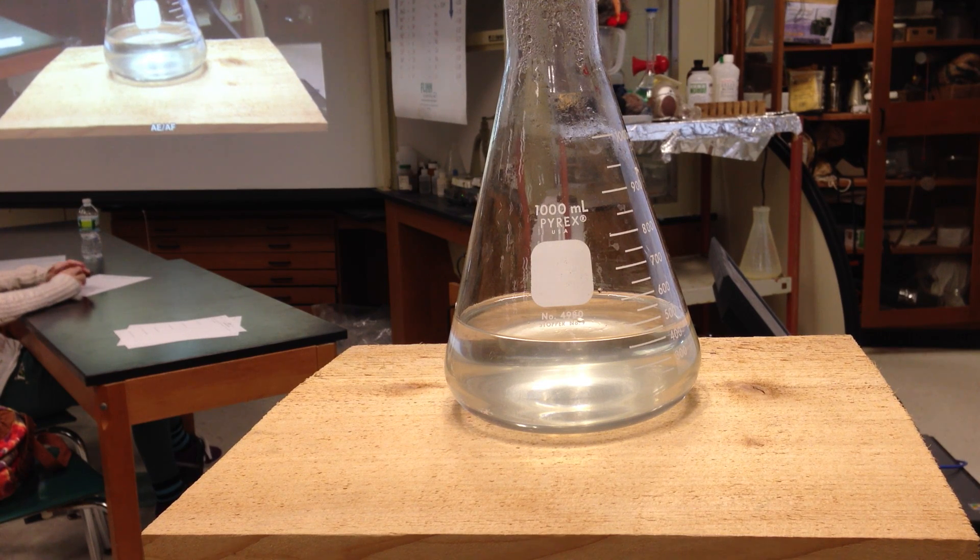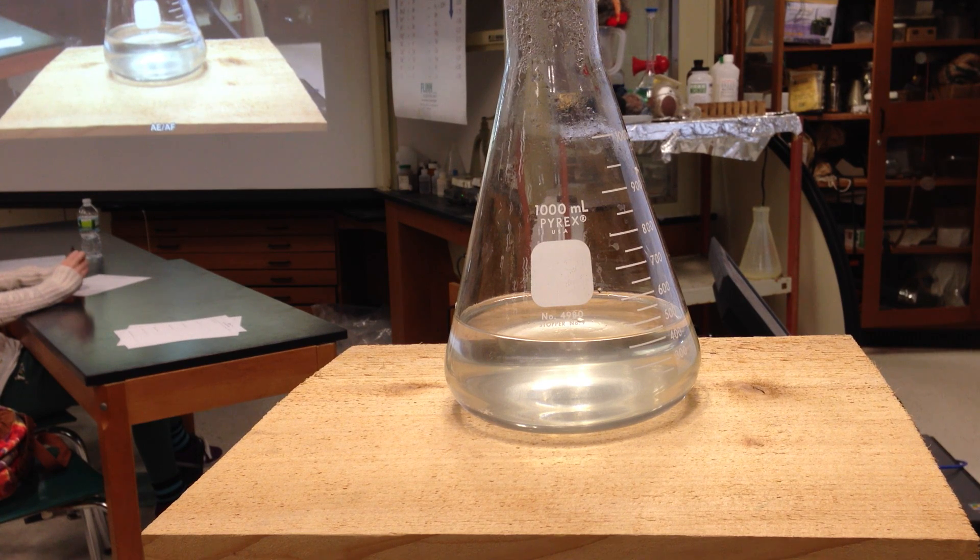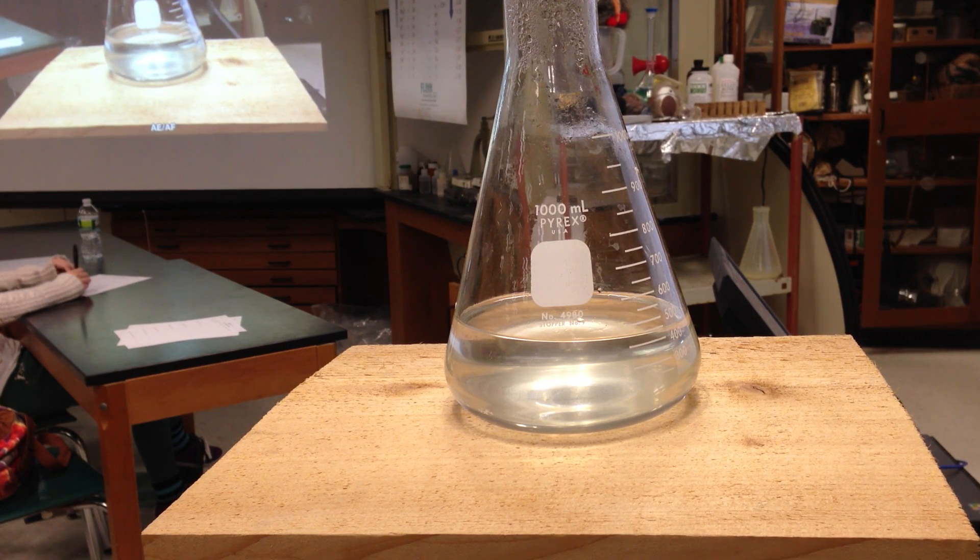Now, supersaturated solutions are unstable, which means they're eventually going to come out of solution. So if I let that stand at some point, the water's going to evaporate off enough to precipitate, or something inside will cause it to precipitate.